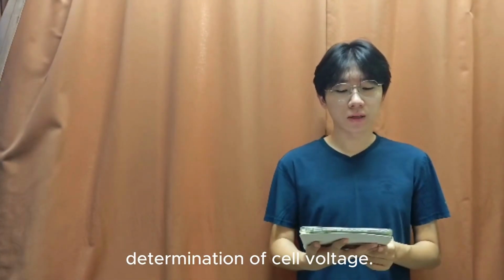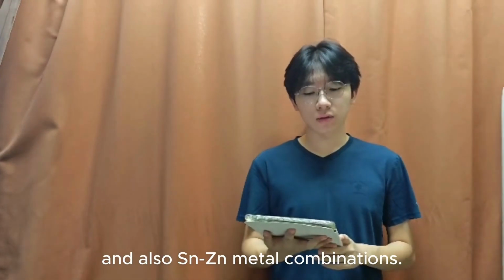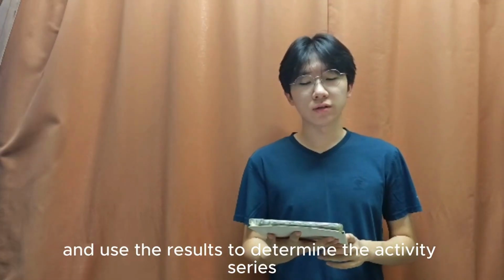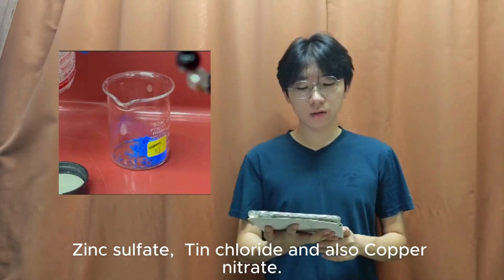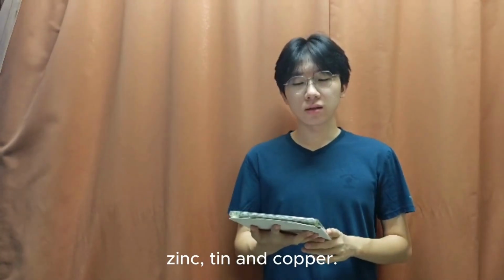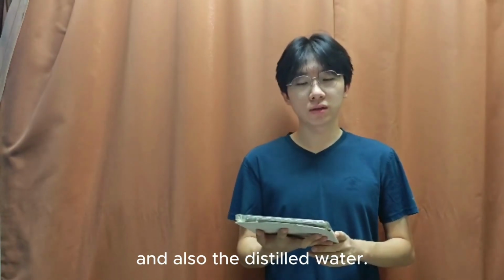For part A, determination of cell voltage, we will construct three voltaic cells using Zn-Cu, Mg-Zn, and Sn-Zn metal combinations. Our goal is to measure the cell voltage and use the results to determine the activity series of the metals involved. The chemicals used in part A include 1 molar solutions of magnesium chloride, zinc sulfate, tin chloride, and copper nitrate. We also use metal strips of magnesium, zinc, tin, and copper. The apparatus include beaker, crocodile clips, filter paper for the salt bridge, and distilled water.